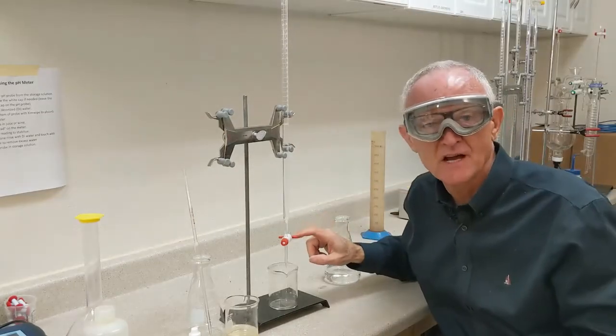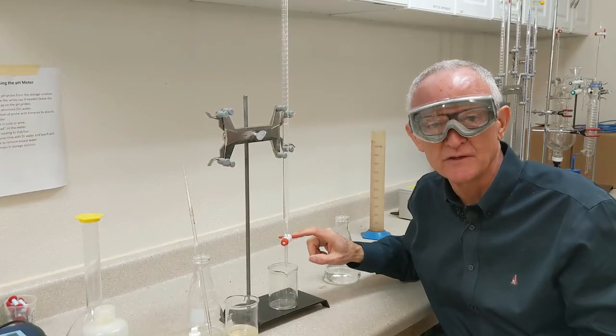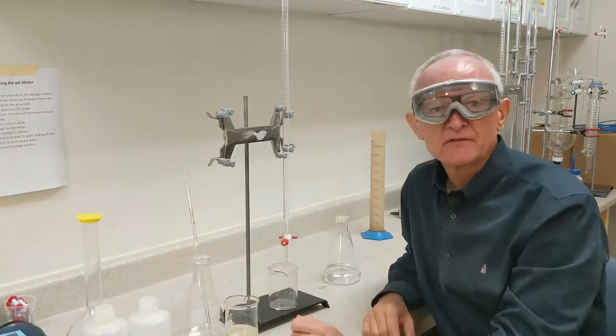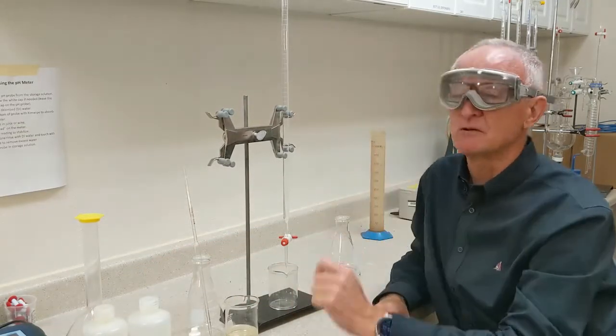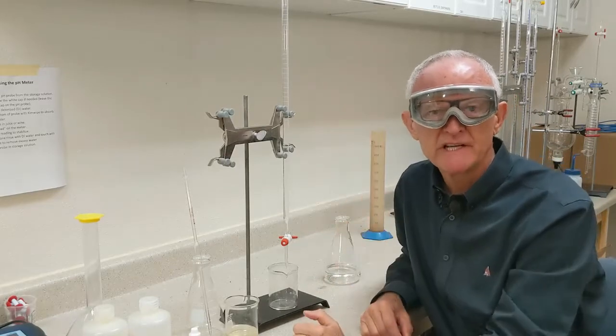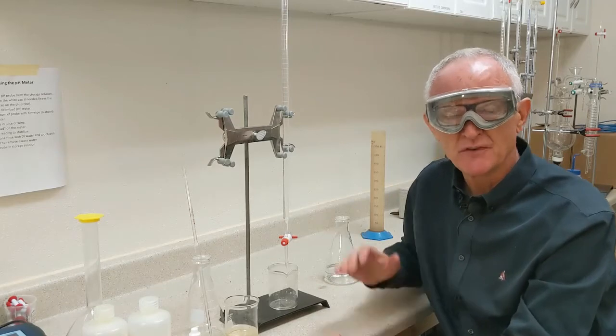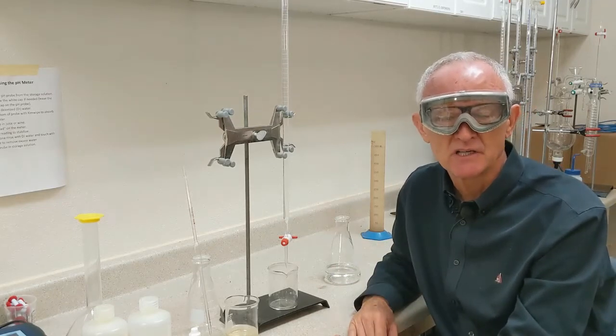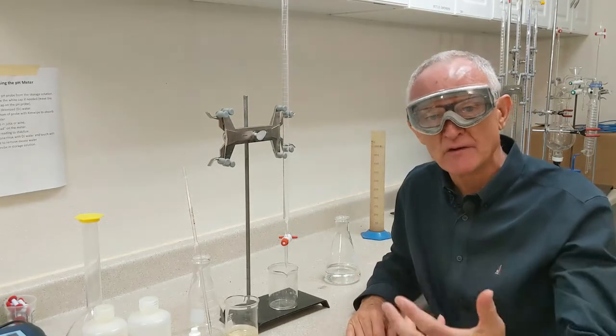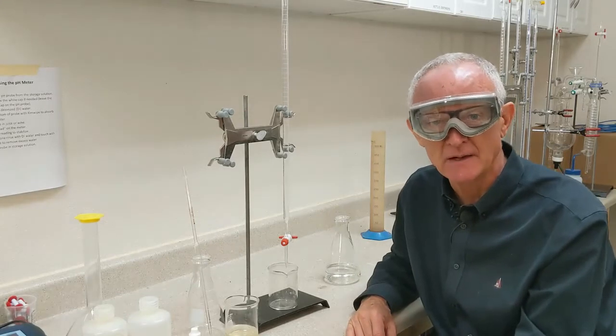I've made sure my stopcock is closed before I filled the burette. You don't have to fill the burette right to the zero mark. We're going to read the starting volume every time we do a titration. So just fill it up so you have enough to do a couple of titrations or however many you're doing that day in your lab.